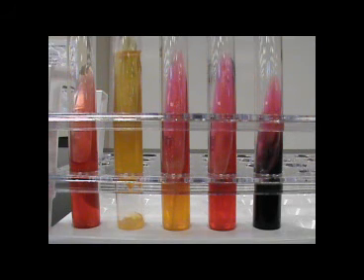The TSI is very helpful in differentiating monosaccharide versus disaccharide fermentation. It is commonly used for the identification of gram-negative enteric bacteria, although it can be used for many gram-positives. The added result of hydrogen sulfide production is also helpful in differentiating between different species of bacteria. The TSI can also be used to confirm or in conjunction with phenol red broths.